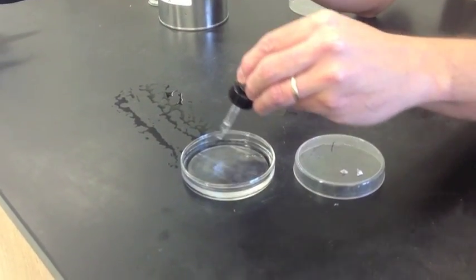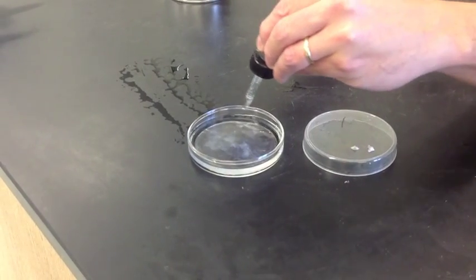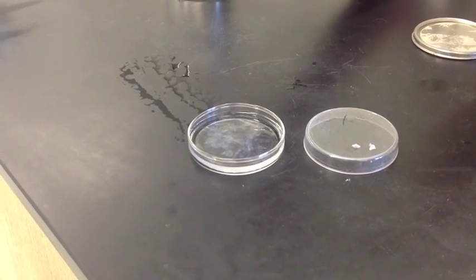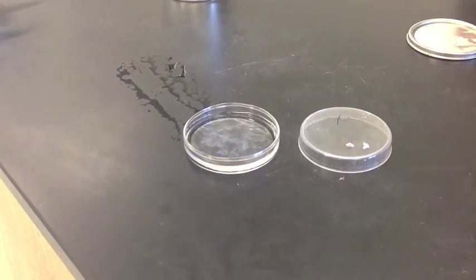So I'm going to just put this in there. Again, the only purpose of this is to show us that a base is being produced. It's not really going to react with the sodium.